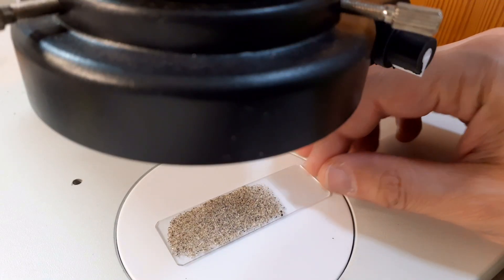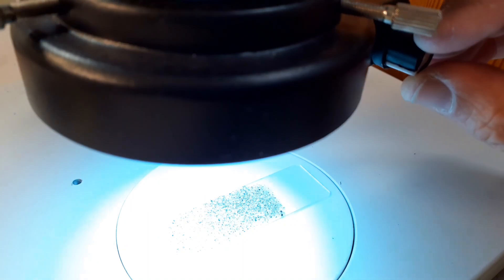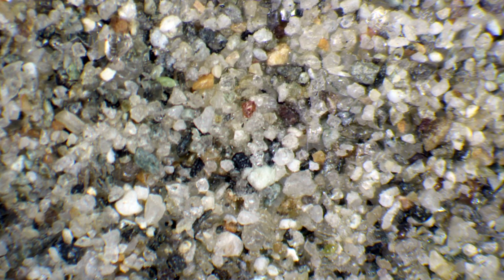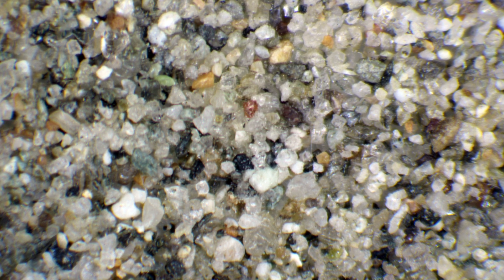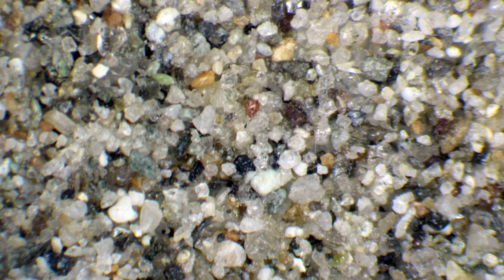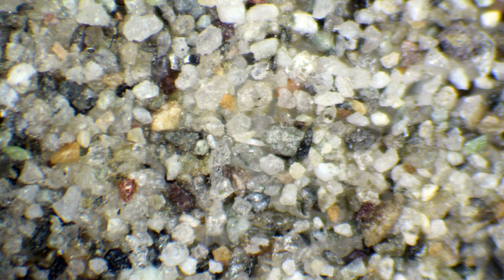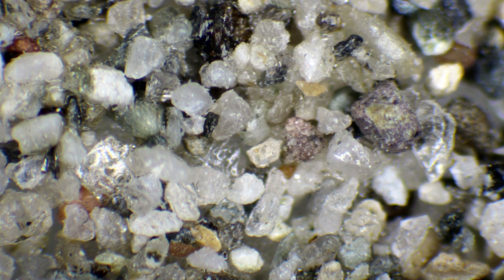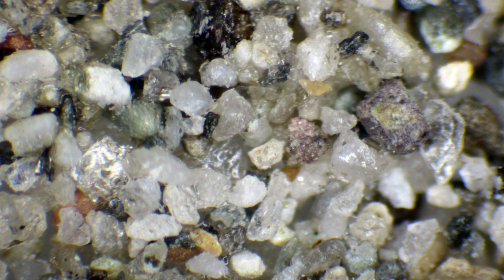So I first of course put it under the stereo microscope and let's have a little test and let's look at the sand and this is how it looks like. Very nice and evenly distributed, and also the nail polish is not visible, of course not visible, it's beneath the sand grains. And even there where the nail polish is visible it really does not disturb at all.